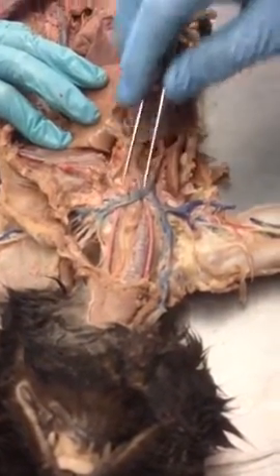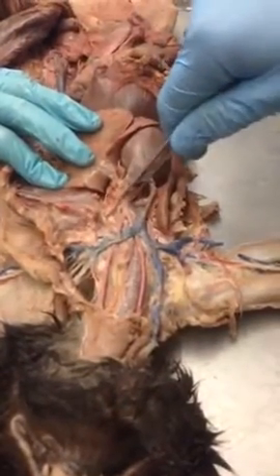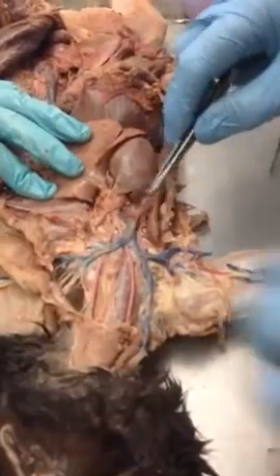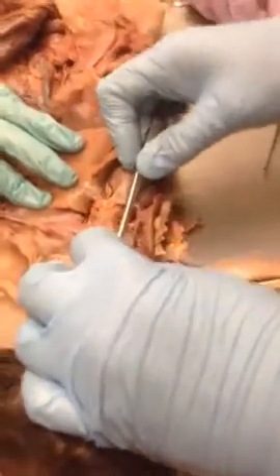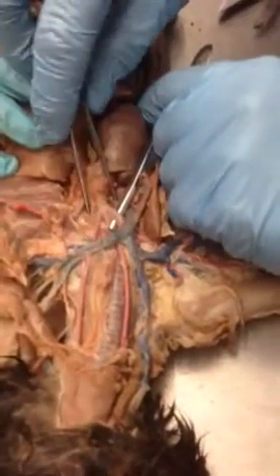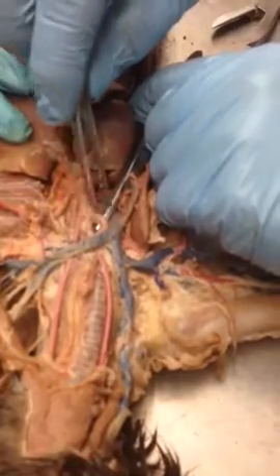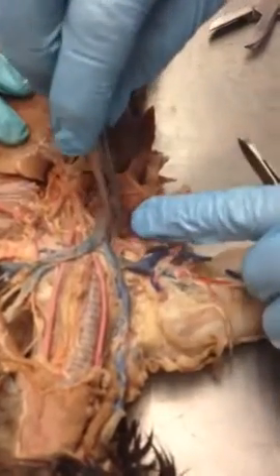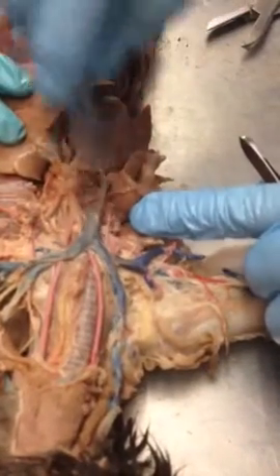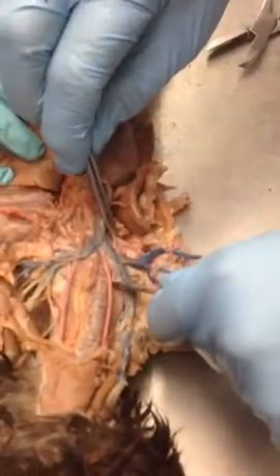Now that takes care of the head part, but remember we have brachial in this thing, which means arm, right? So if you look, it's kind of hiding under here, under the vein. But see this branch right here? Here's our brachiocephalic. So there's the common carotids that are coming out right there. And then this branch is heading this way. Now that becomes a subclavian because the clavicle is right here.